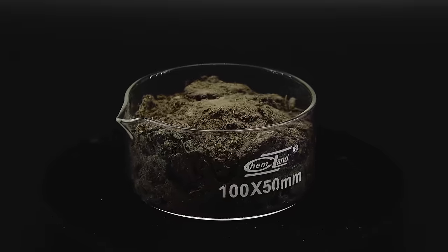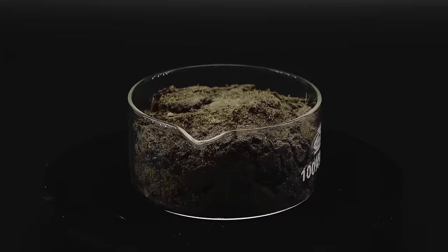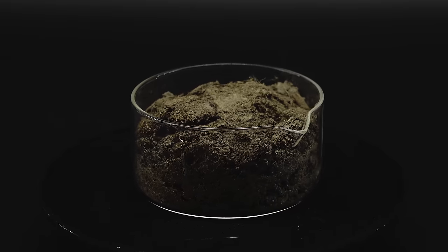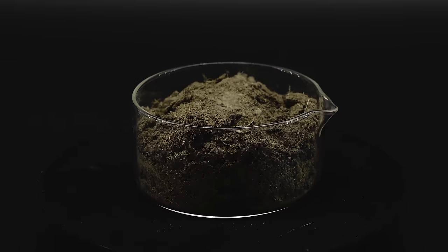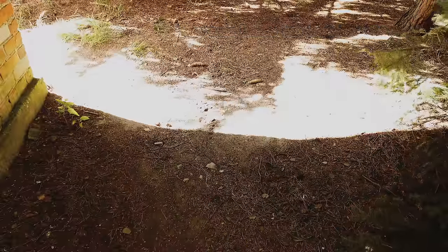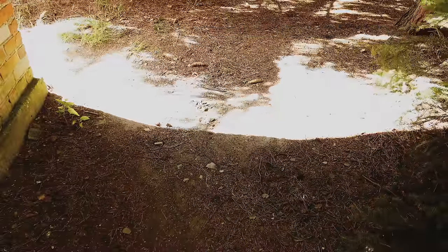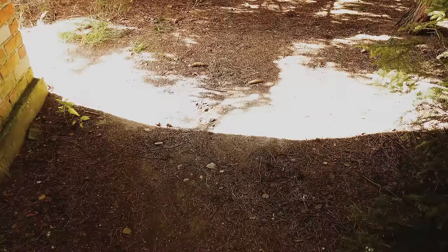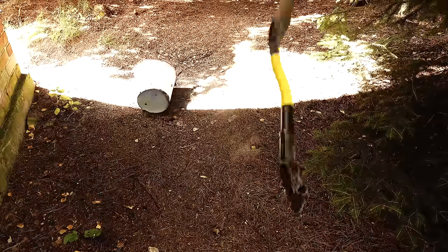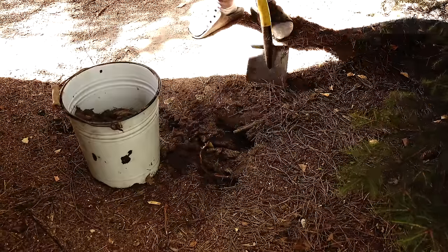To get my silicon dioxide, I first have to extract some really pure sand from dirt. To do that, I have to do something this lab goblin rarely does, and that is going outside. As the next step, I have to collect some raw dirt, and for that I chose the same exact spot as in my last silicon extraction project. With the help of a bucket and a shovel, I collected an arbitrary amount of some plain old dirt.